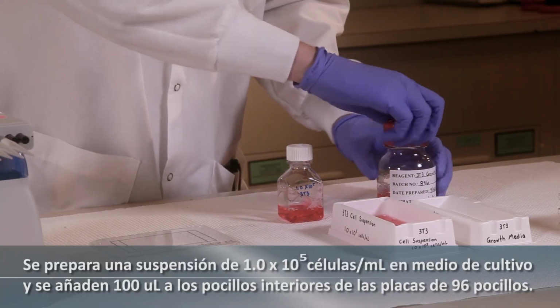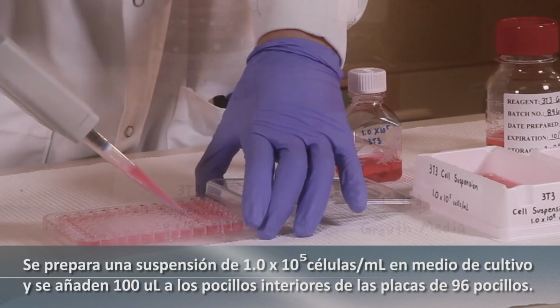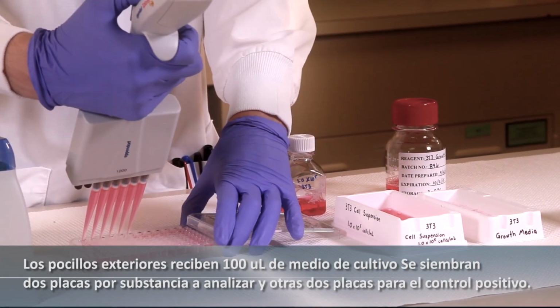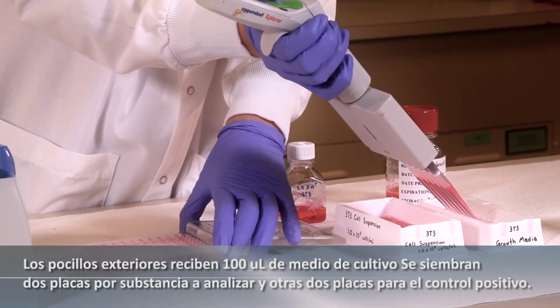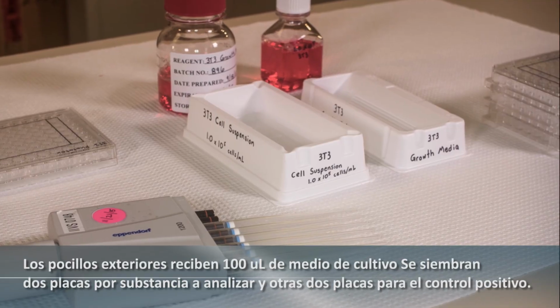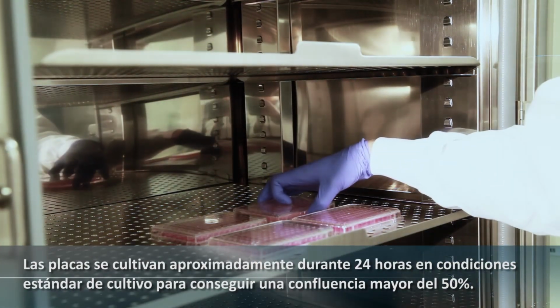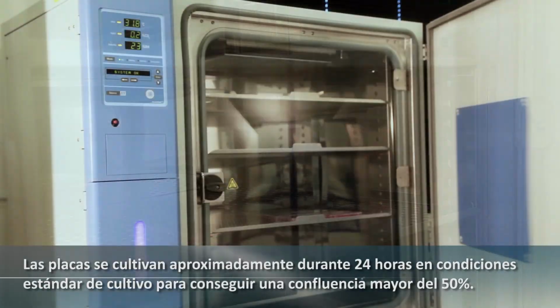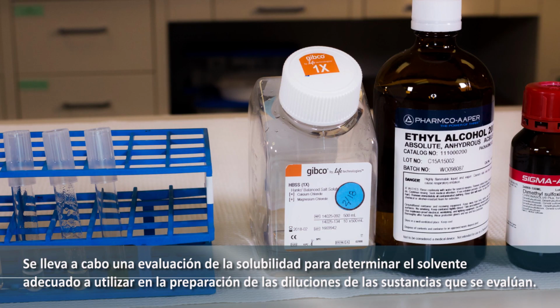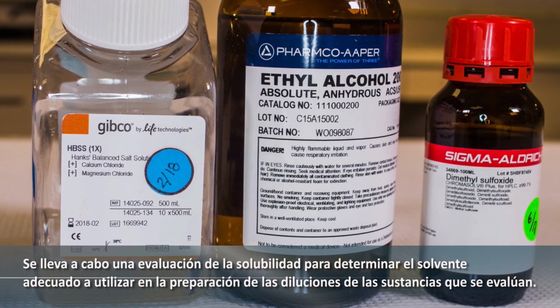A cell suspension of 100,000 cells per milliliter is prepared in growth medium, and 100 microliters is added to the interior wells of the 96-well plates. The outer wells receive 100 microliters of growth medium. Two plates are seeded per test substance, and two plates are seeded for the positive control. The plates are then incubated for approximately 24 hours under standard culture conditions to achieve a confluency of greater than 50%.